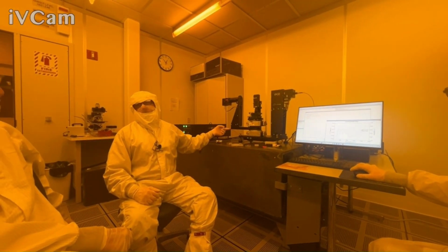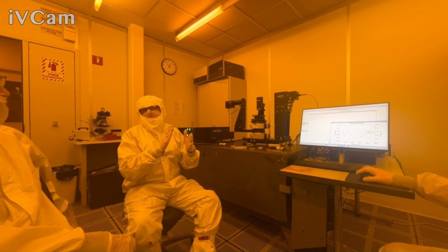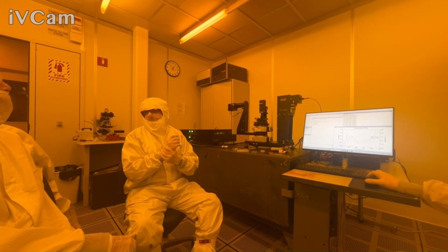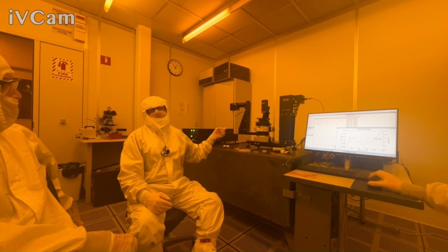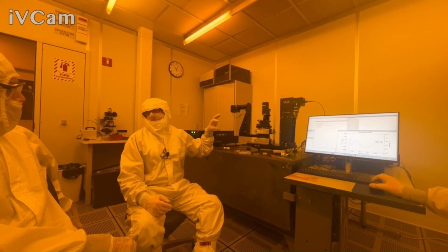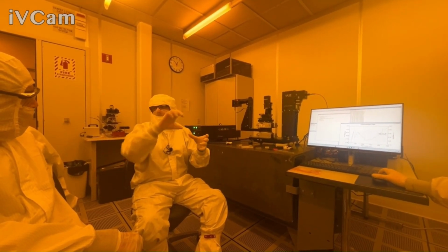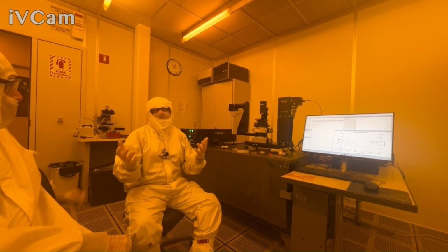If we had a secondary arm, we used to be able to go to 3200 on that secondary detector. We stopped doing that detector about a year or so ago because we were having some performance issues. We offered it for many, many years. But we do have a secondary arm that goes out to 4 microns. That's liquid nitrogen cooled, so if you want to use it, you basically pour liquid nitrogen to run that one. So it's possible, it's just harder.